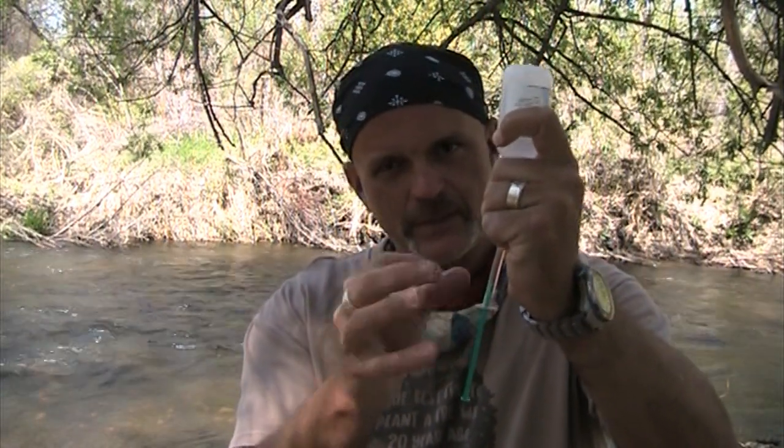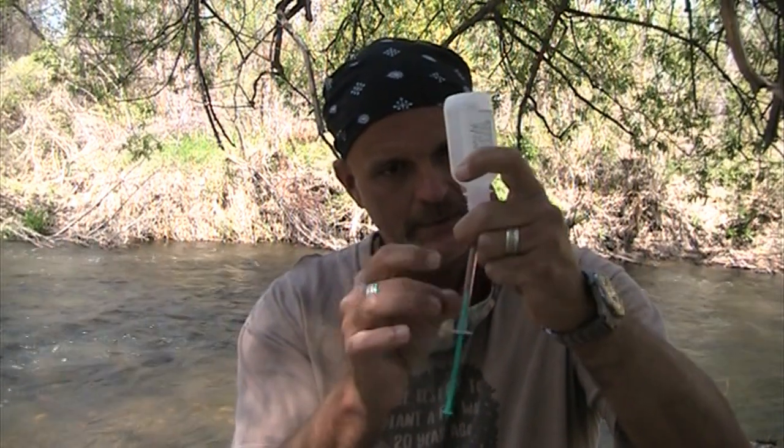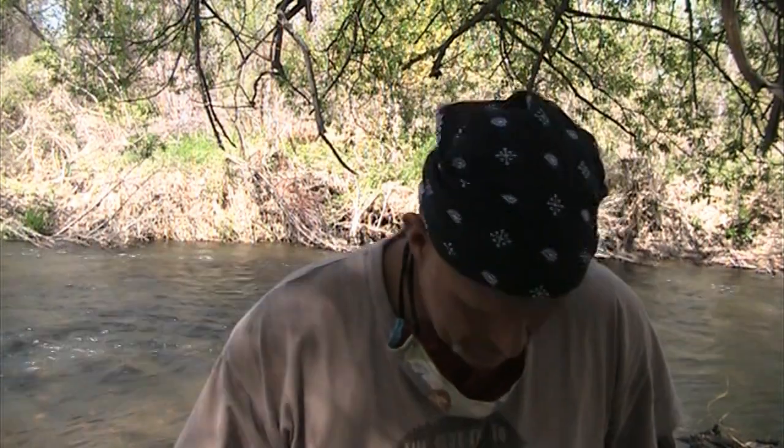It's really creepy, especially when you're kind of got a pirate look going on today. Then you're going to go back and squeeze the air bubbles back in, and then bring the plunger back down to the 0 mark. Gotta do some more flicks. And if you look, I have filled the syringe to the 0 mark. This is where patience is going to be required by both students and those of you who are teachers.